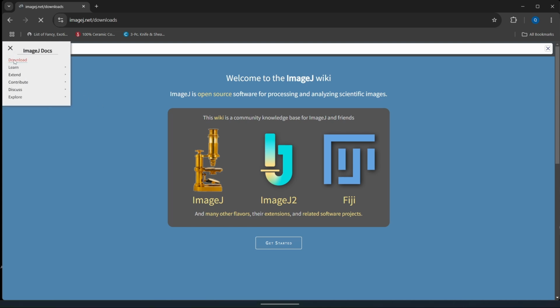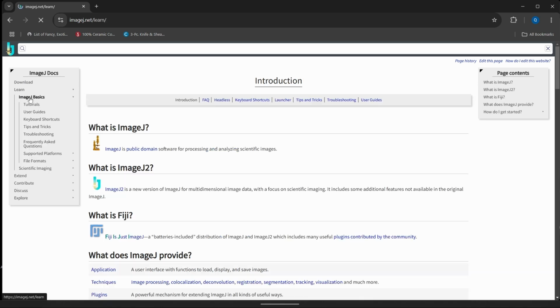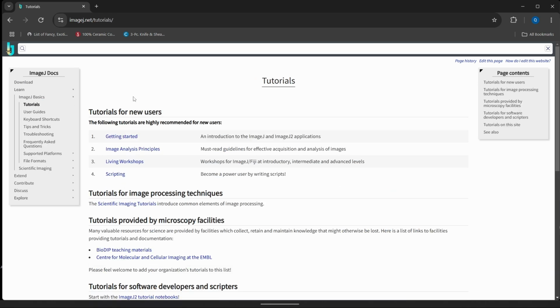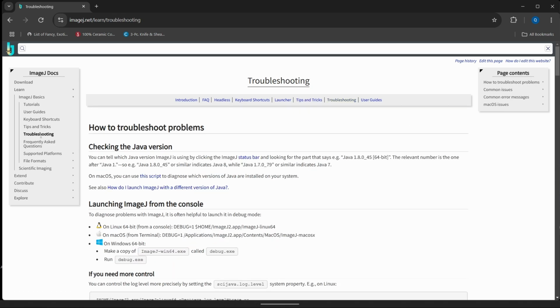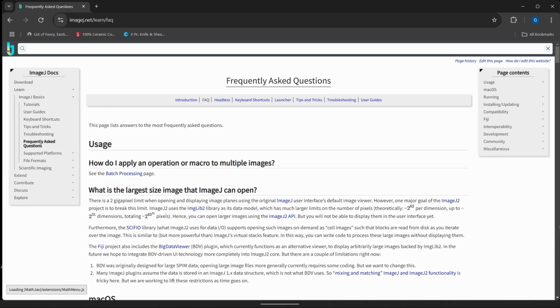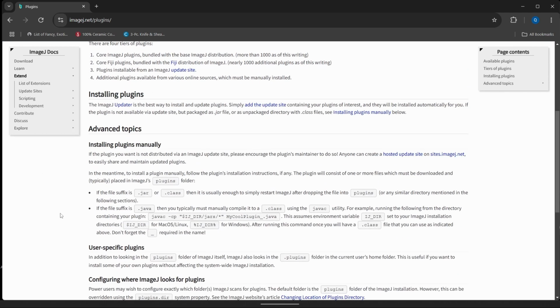So I just wanted to show you that if you wanted to learn new things, or if you ever needed help with ImageJ, how it works, why it's doing what it's doing, you can always talk to the TAs, but it might be quicker, especially if we're in the lab late at night, to be using this ImageJ wiki. So we can go tutorials, user guides, tips and tricks, troubleshooting, frequently asked questions, and we can even extend into plugins.